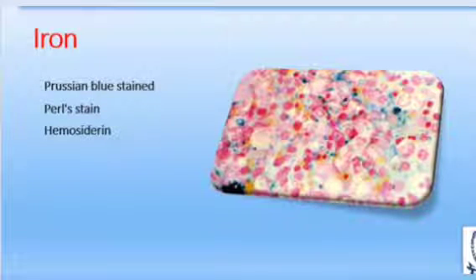Some bone marrow samples need special staining, like in iron deficiency anemia or some iron storage disease. We need iron or Prussian blue stain, also called Perls stain. Examine the Prussian blue stained smear first under low power for visible hemosiderin fragments, and a slight color or a few granules are normally present. Note whether iron hemosiderin is increased or absent.